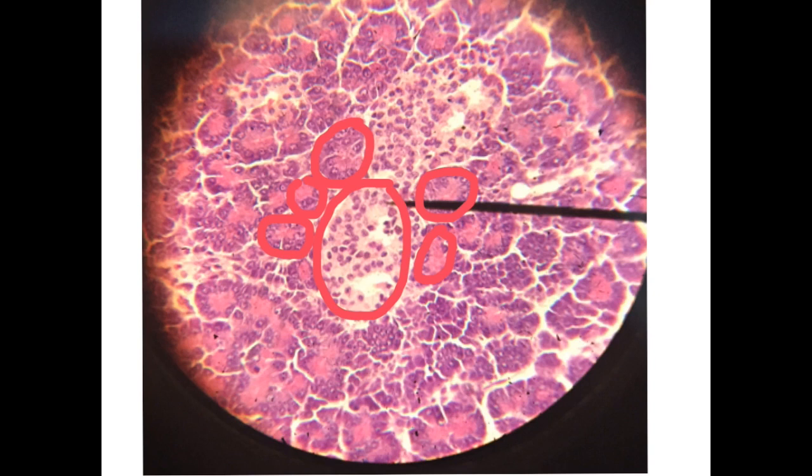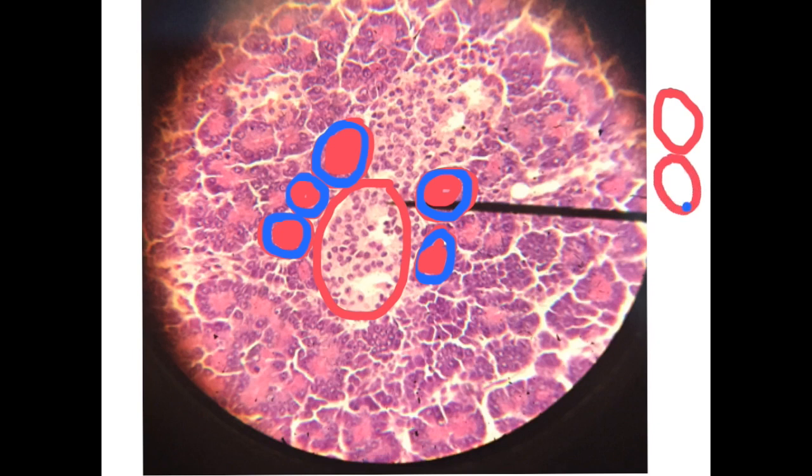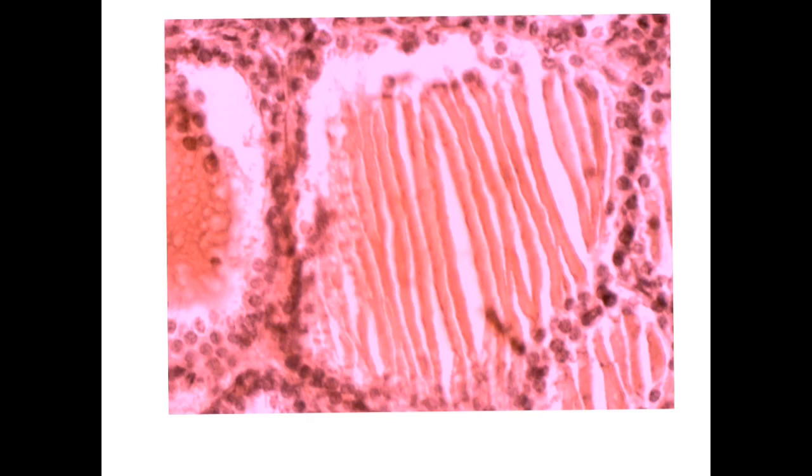So, by looking to the surrounding tissue, you will notice that we have the acini, and actually the acini have a dark peripheral part or a basophilic peripheral part and an acidophilic central part. So here we have the picture like this, with no lumen inside. While in case of the renal corpuscle, we will have tubules surrounding. We will have these tubules surrounding the renal corpuscle with a lumen, and on the wall of the tubules you will see this row of cells.